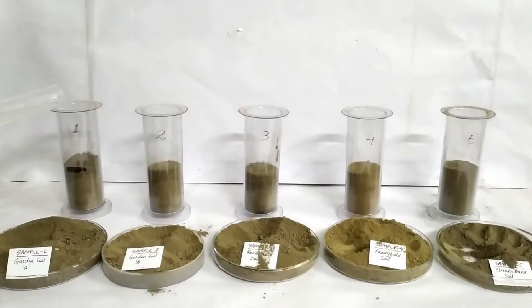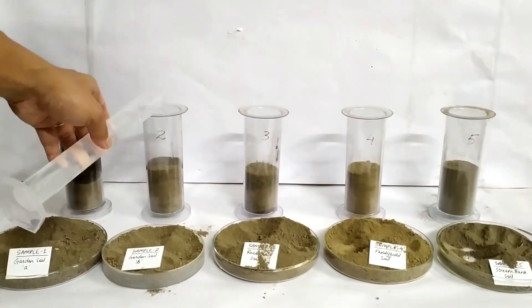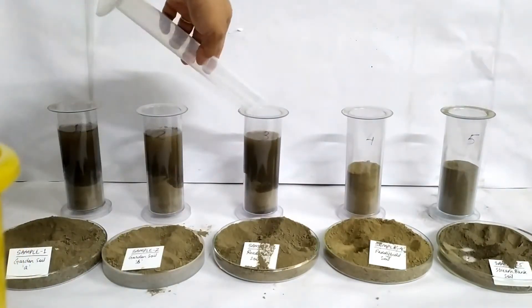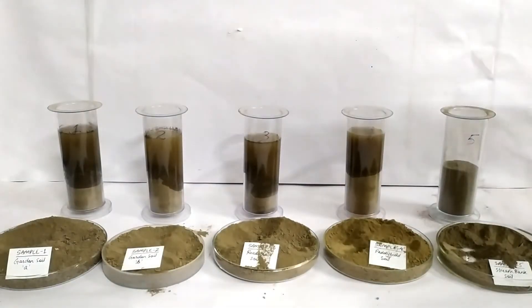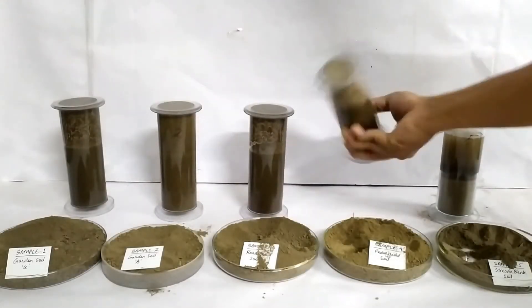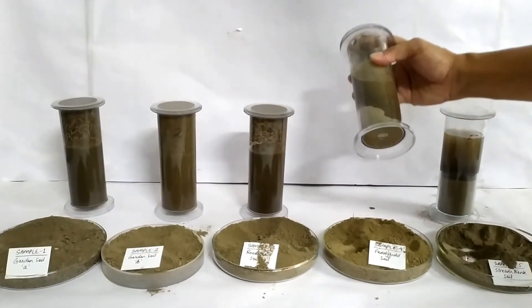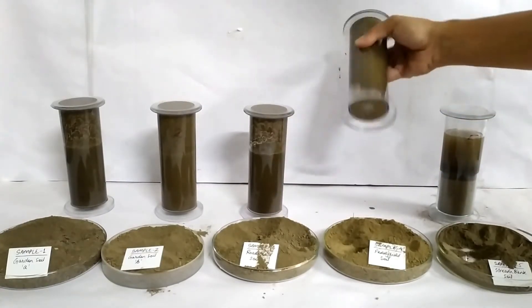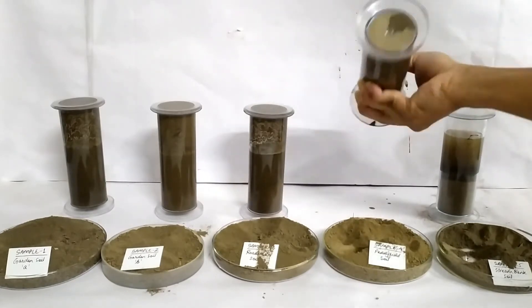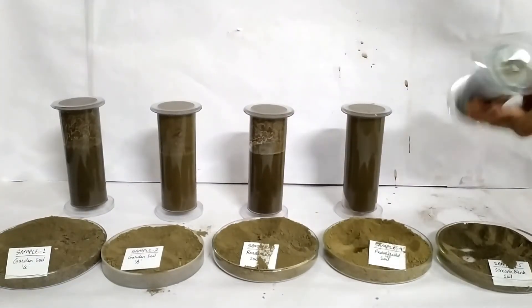Then add equal quantities of water to each container such that the water level is at least five to ten centimeters above the soil samples. You can also add a teaspoonful of detergent powder into each jar — the detergent acts as a surfactant and helps in the effective separation and resolution of the sand, silt, and clay components. Cover each container using a lid or the palm of your hands and shake the contents vigorously for a couple of minutes to homogenize the soil and achieve thorough mixing with the water. Leave the containers undisturbed for a couple of hours to overnight to allow the components of the soil to settle down by the force of gravity.